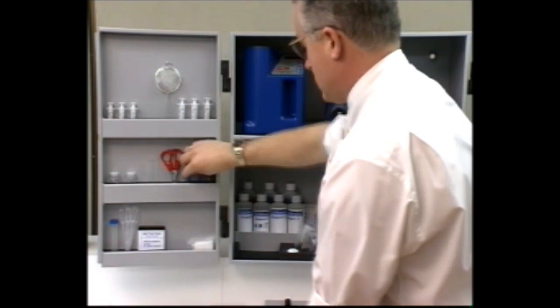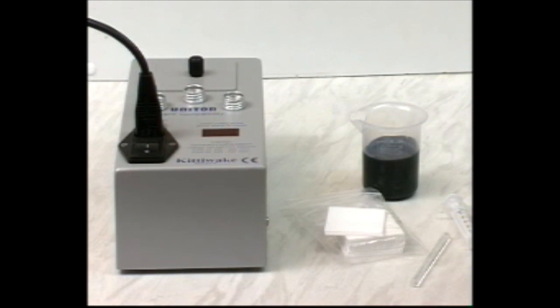The compatibility test unit is fitted with a timer. For how to set up the equipment, see the timer section in your user manual.